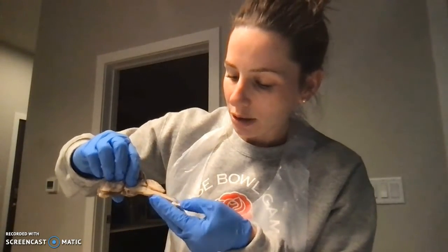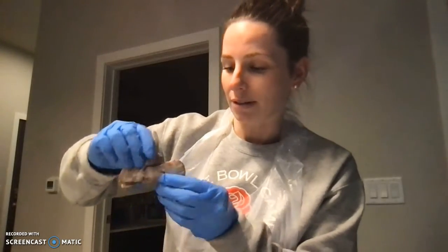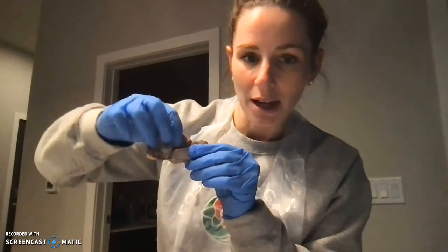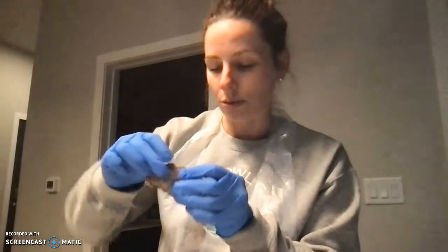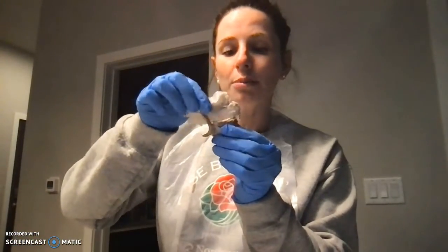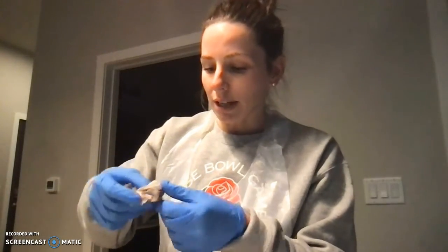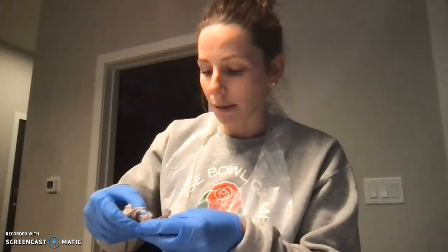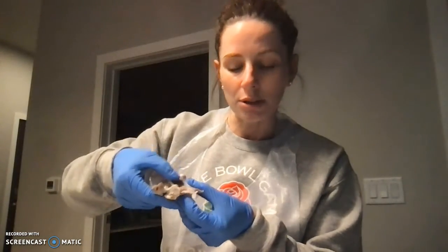So all of these structures then would lead down to the spinal cord, and these are all kind of falling apart, so sorry. But the spinal cord would then form down here and then go down into the vertebrae. And then I have some pieces of the meninges, which are thicker, tougher material that cover the whole outside of the brain. And when I was making these cuts, it was cool because I saw a lot of the cranial nerves that were attached in between the meninges and then to the brain.